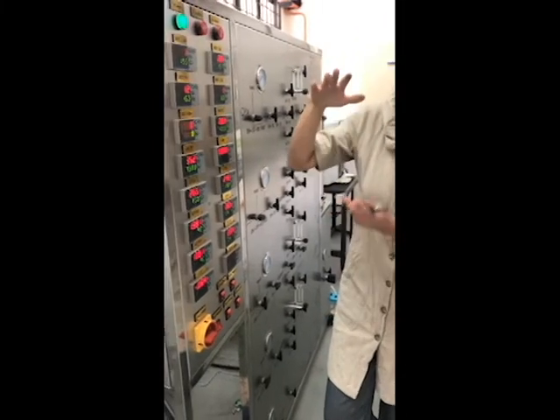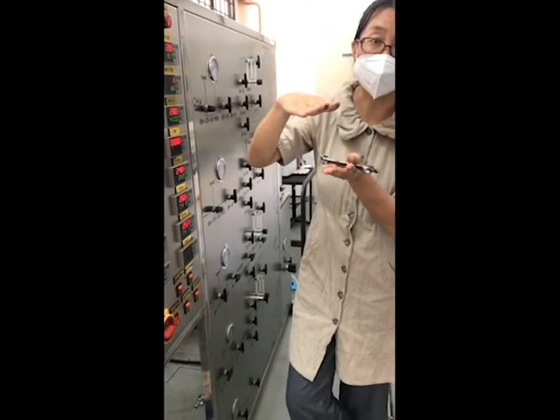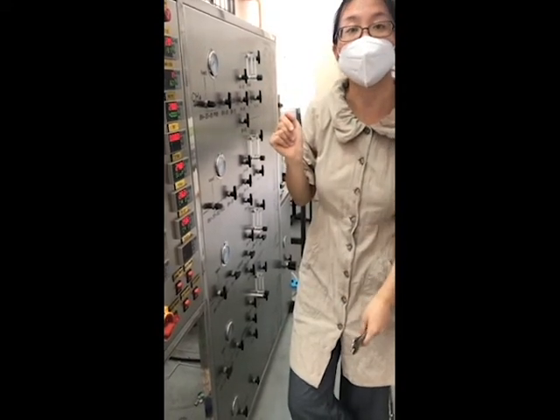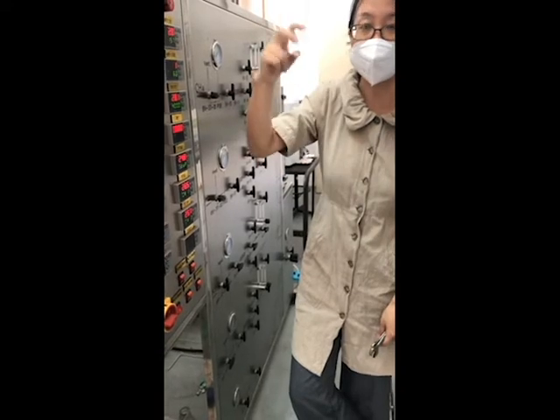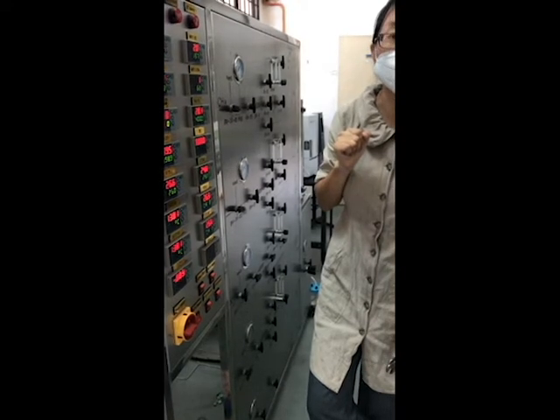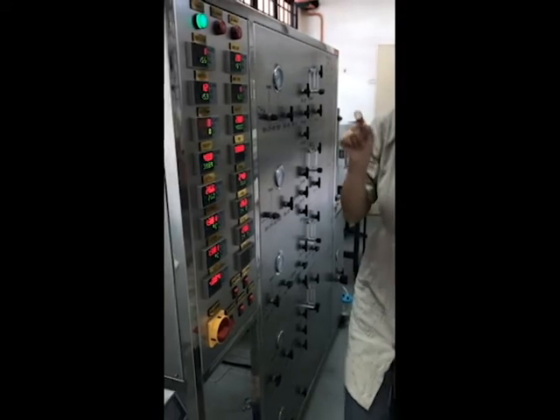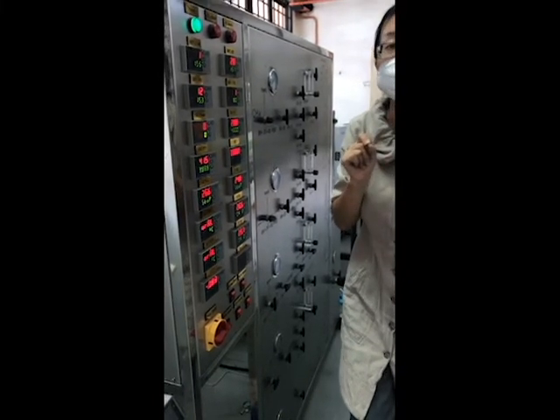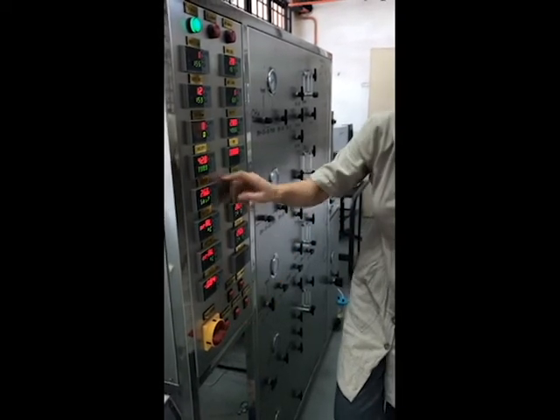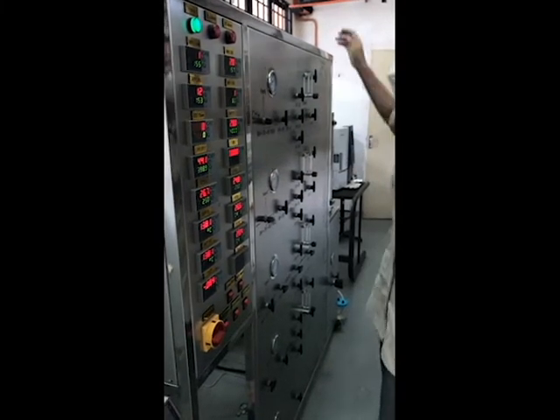And second, because your catalyst is loaded in the center of the reactor, at the top part there is still some space to preheat the gas. So we can make sure that when the gas comes into contact with your catalyst, it is already heated to the target temperature. So there will be no big temperature difference, and the reaction is really conducted at 700 degrees Celsius. This is the preheat. Then another one is the program temperature control 1, because you install your reactor in reactor 1.